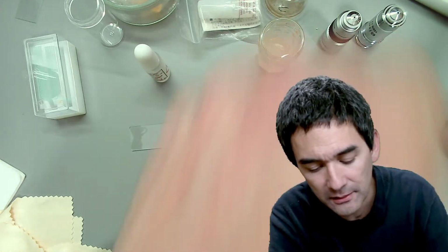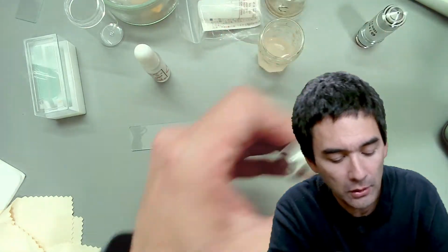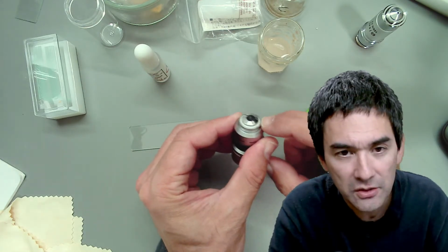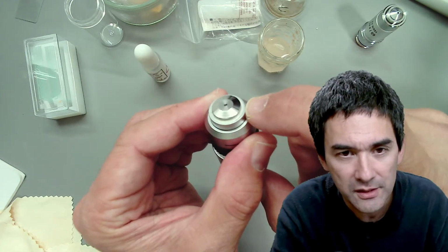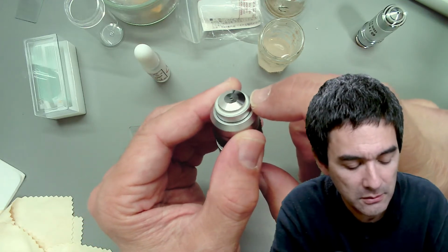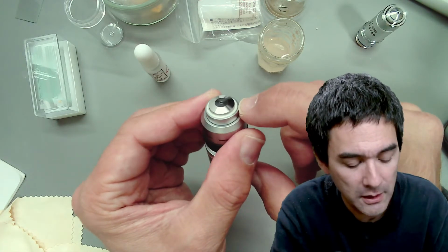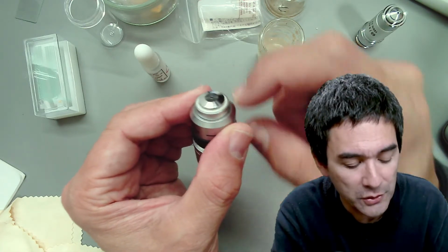the lenses, then be careful, because look over here. This here is an oil immersion lens. Do you see the white ring here? I don't know if you're able to see this. This seems to be some kind of cement, plastic, or rubber maybe, and has been applied here to seal it off so that no oil can go in.